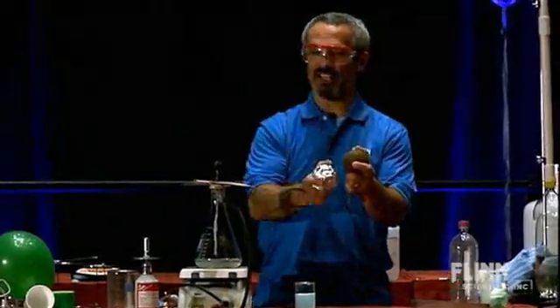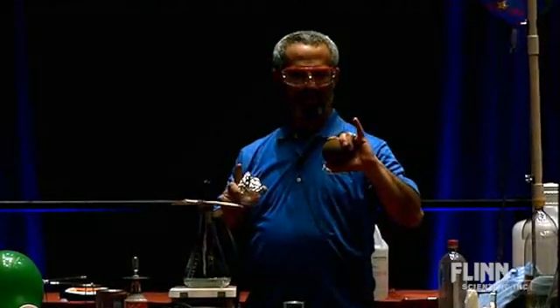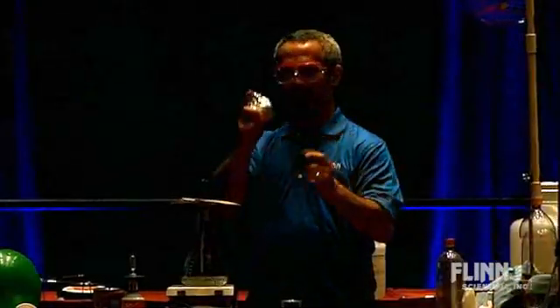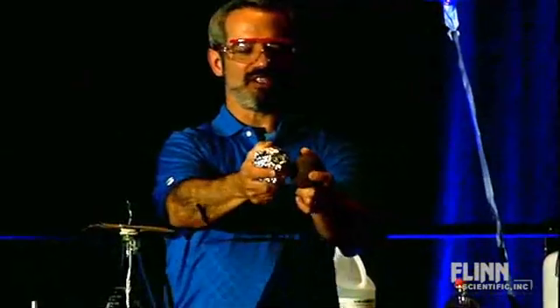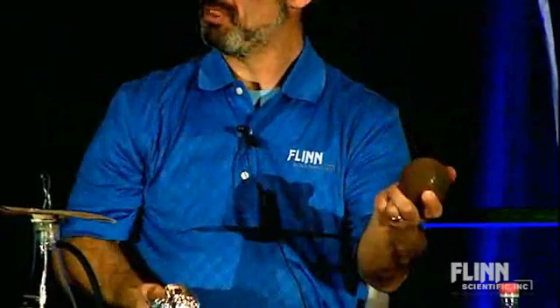So I'm going to smash these together. I saw a really good photo of this in the exhibit hall — go search the exhibit hall later on, there's a big bulletin board. First, with the lights on so you can see, and so I don't hit my thumb. Wow.